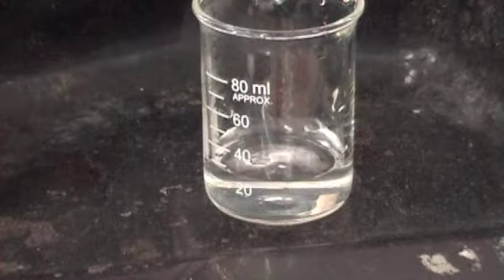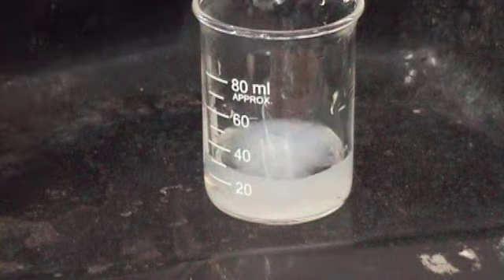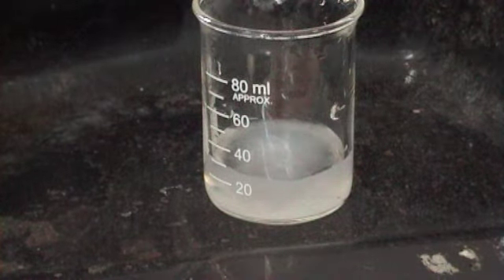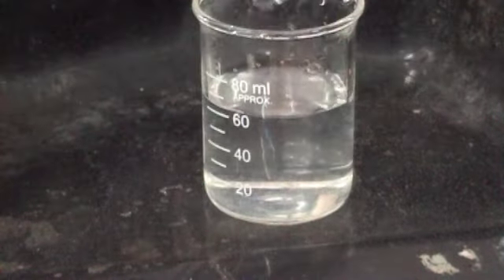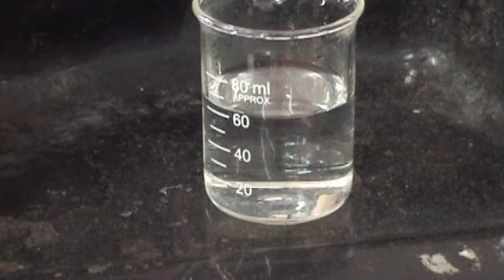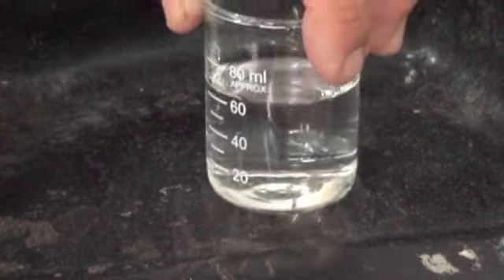Okay? Okay, so a new sample, and this time we're going to use ammonia, the other very useful solution. We expect to get a precipitate first up, and we do, alright, because again it's alkaline, so you get zinc hydroxide, right? When I add in more ammonia, okay, the precipitate redissolves. Now you can see I'm using quite large quantities here, so I had to put quite a bit in. You can do it much more carefully in your small test tubes on Friday. But if in doubt, if you don't feel you're getting the right result, repeat it, do it again, use more, okay? Okay, so that shows us that it's either zinc or... Oh no, it's only zinc, isn't it?